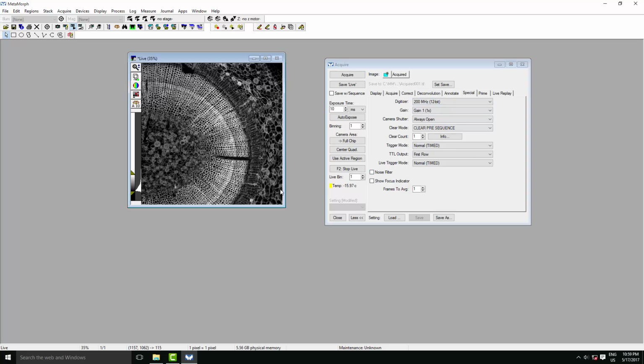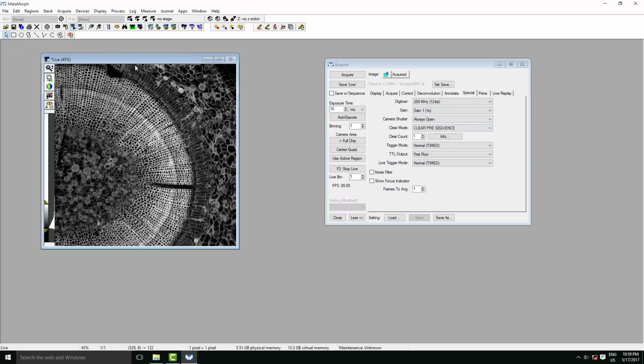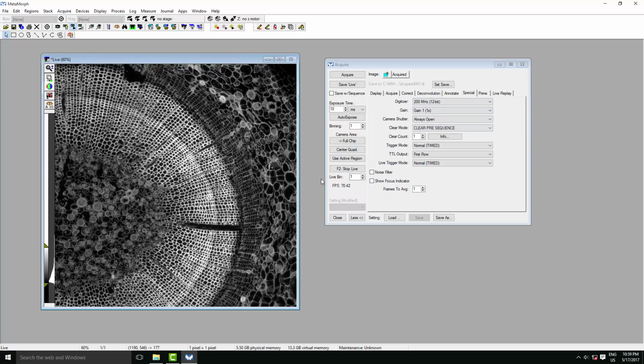So now we'll go to our live view, and here we have our image. The Prime95B is a back illuminated CMOS sensor with a 1200 by 1200 resolution and 95% quantum efficiency. It's also got really low read noise, meaning that this is a perfect camera for applications that demand sensitivity in addition to good field of view and high speed.